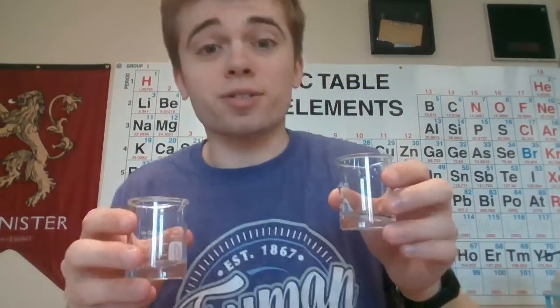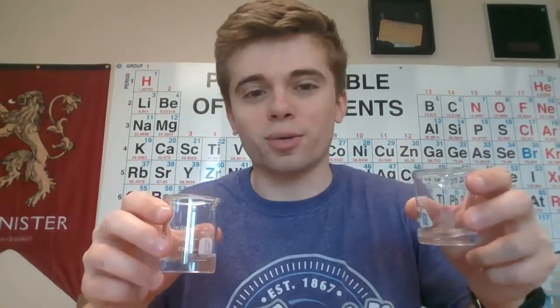So I have my solution A here that I'm going to pour in the beaker. And I have my 10 milliliters of solution B that I'm going to pour in this beaker up here. What I'm going to do is as soon as I dump one of these beakers into the other, I want you to go ahead and start your timers, and we're going to time how long it takes for this solution to go blue. And you're going to want to make sure that you're watching closely because it occurs pretty fast. So I'm going to mix it here, so make sure your timer is started.